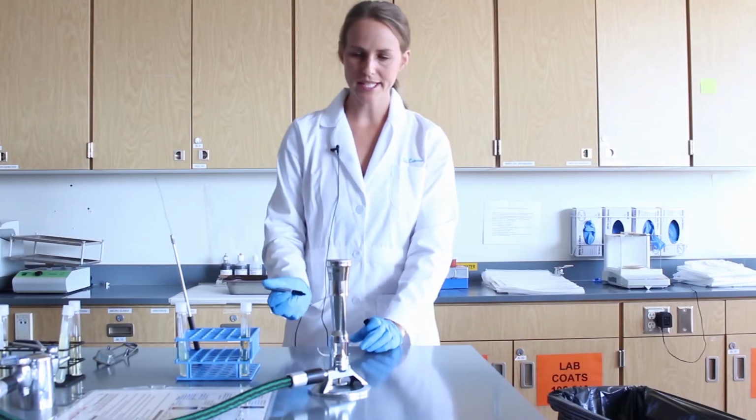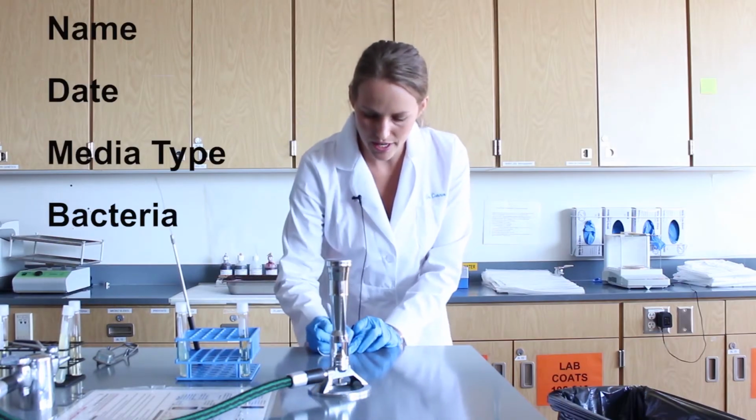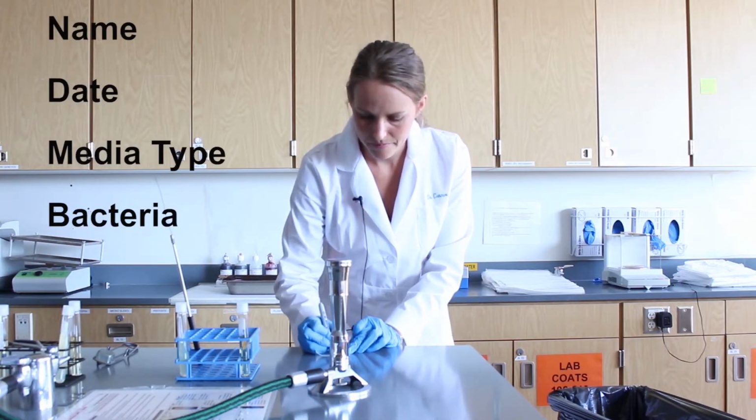Again, your label should be on tape because we reuse these glass vials. Label with your name, date, media type, and bacteria.